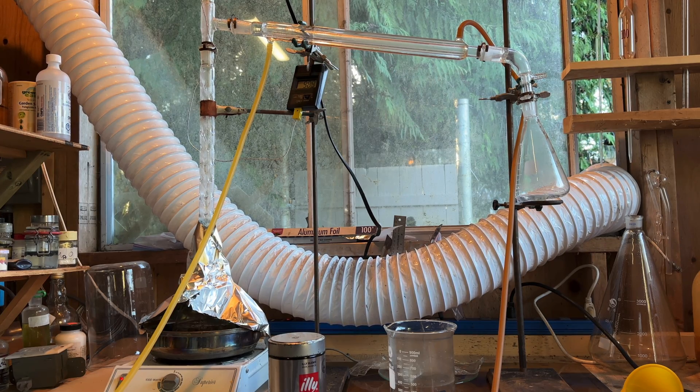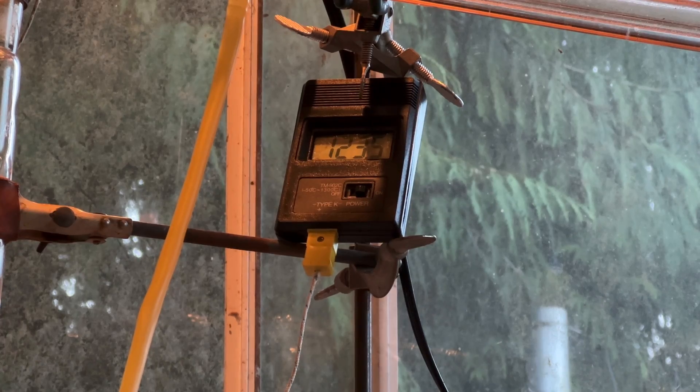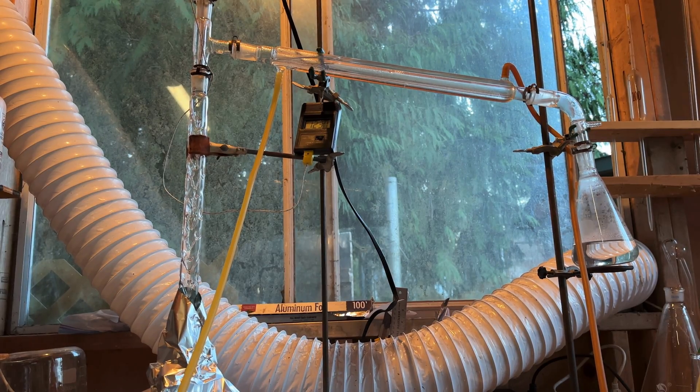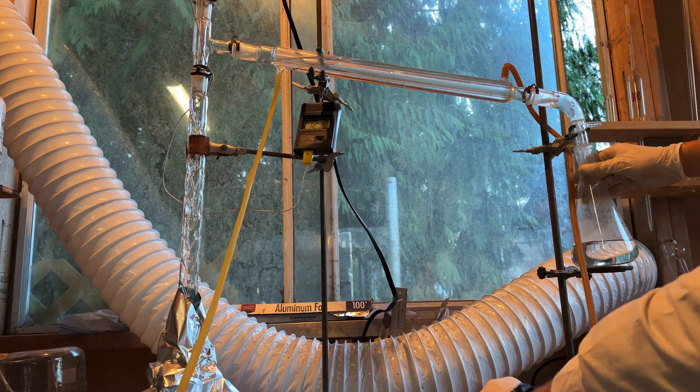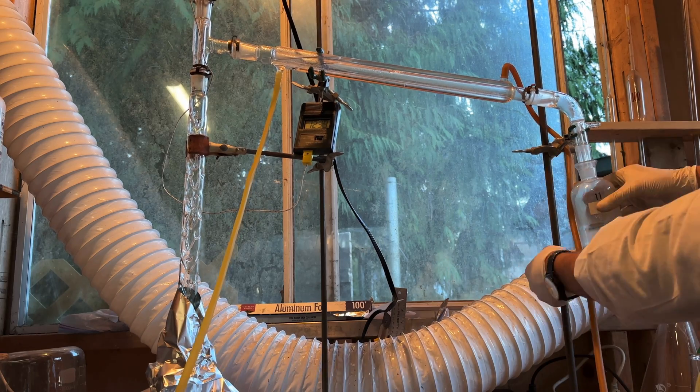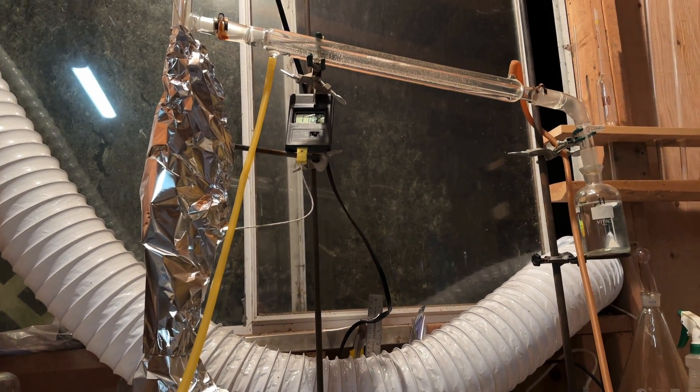Water was collected until the temperature reached 124 degrees Celsius, which indicated that concentrated azeotropic hydrobromic acid was distilling over. The receiving flask was swapped out for an acid storage bottle, and the concentrated hydrobromic acid was collected.